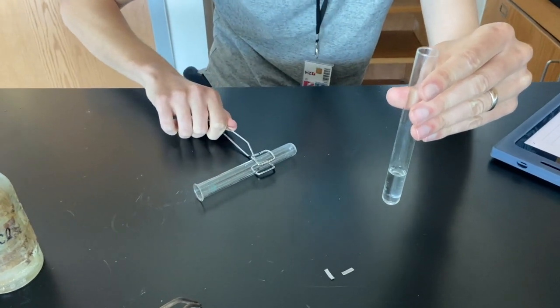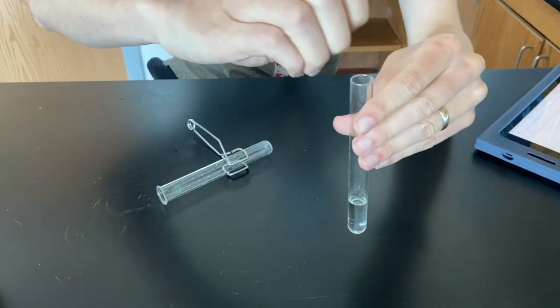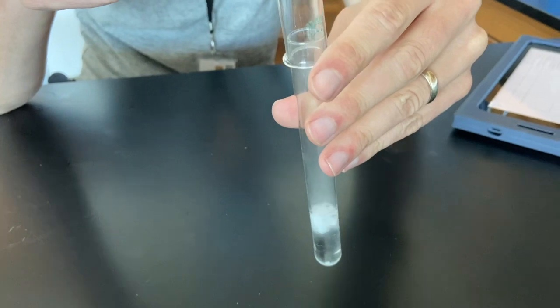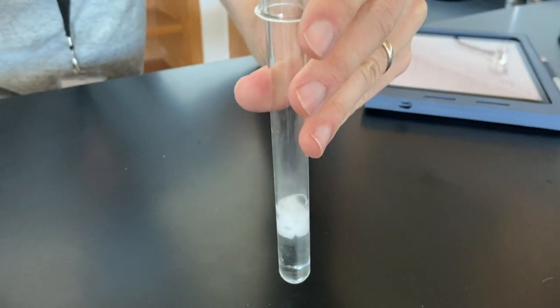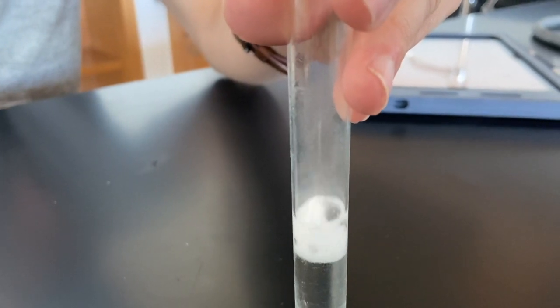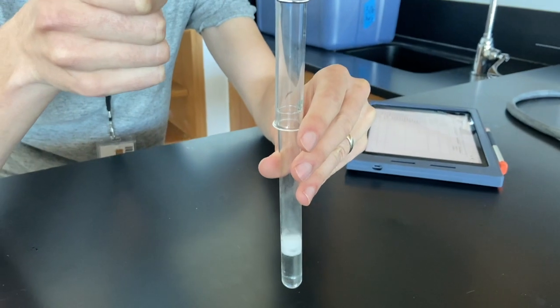This is going to lead right into the next demo. So here we go. I can see something occurring, a fairly vigorous reaction, and I don't know if you're able to catch with that camera the gas that's coming up.